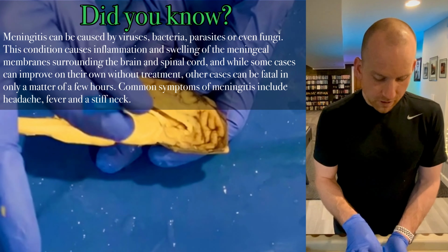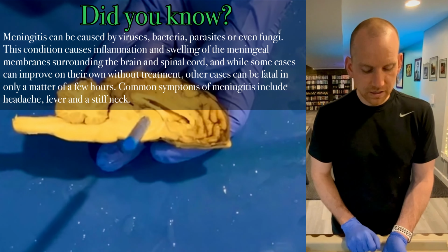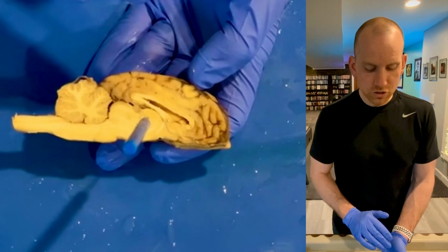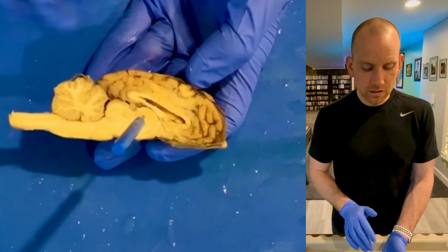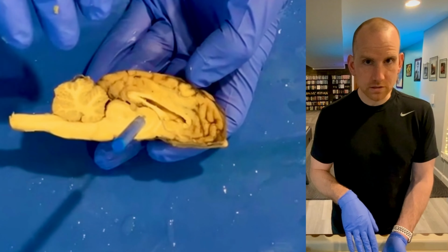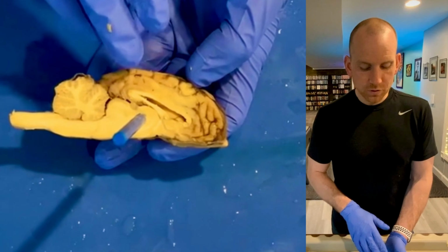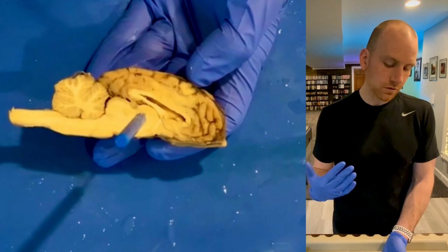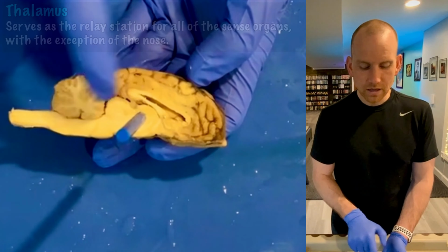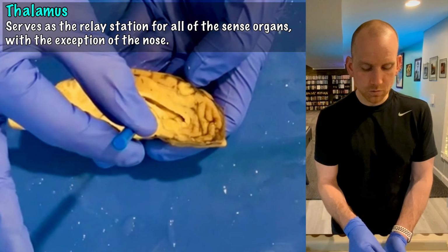Now, I'm going to point right toward the center, and I'm actually going to leave the probe in there. That spot right there is a spot that I've talked about already, and it's incredibly crucial to the proper functioning of the brain, because it is really the relay center. Remember, your brain is really just a processing unit. So it's got to get messages from your sense organs, your eyes, your nose, and so on. Well, remember, your nose is an exception, but all the other sense organs send things to this structure first, and that's called the thalamus. So the thalamus is your relay center.